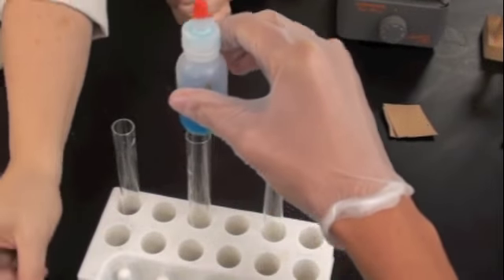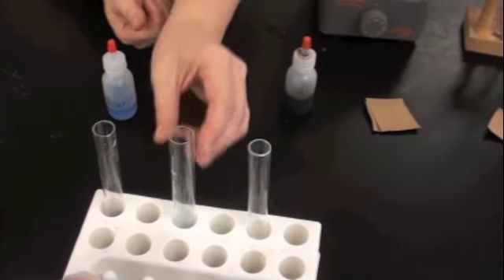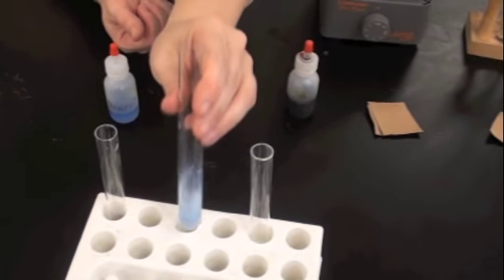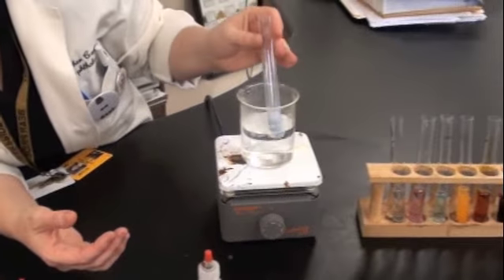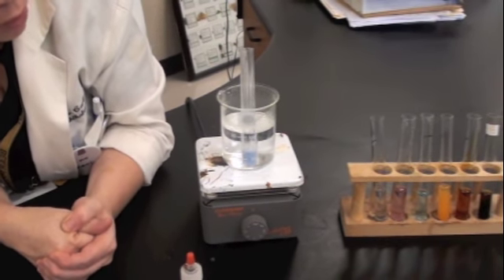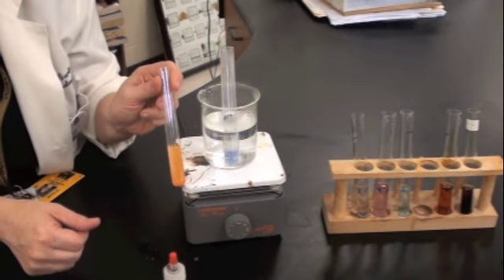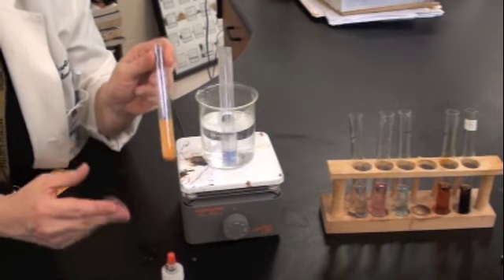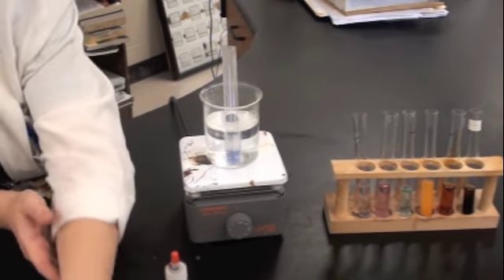Next test is the simple sugar test, and that is 10 drops of this into this tube. Great. Now, we need to heat this. Since this water bath is boiling, I'm going to fly it over here. The heat's required for the reagent to react with the sugars and make the characteristic Sunny D tang reddish brown to orange precipitate. We might need to come back to this.